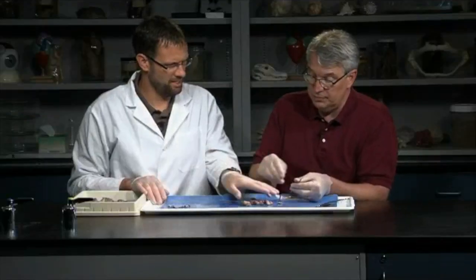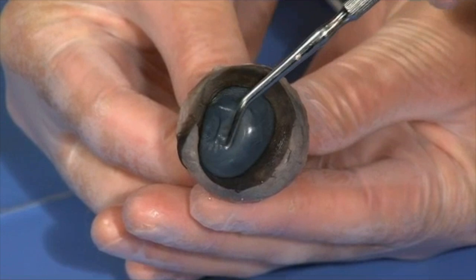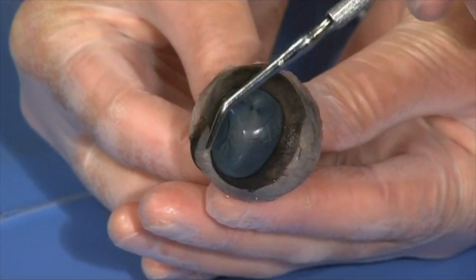As far as identification on the outside now, what do you want to show first? Yeah, so let's start with some identification here. Maybe you want to hold that for me? Okay, so here is the eye capsule itself, and you can see in the front is this transparent or relatively transparent part of it.